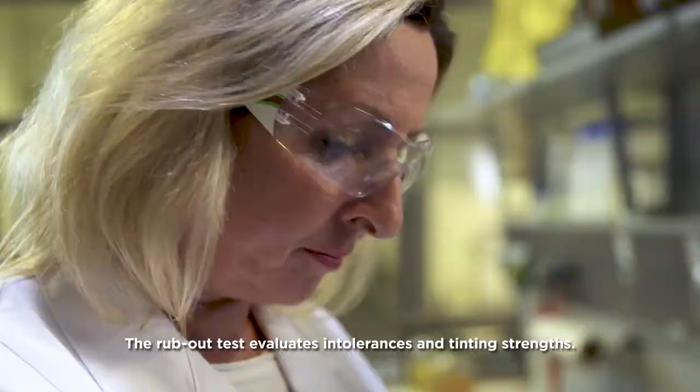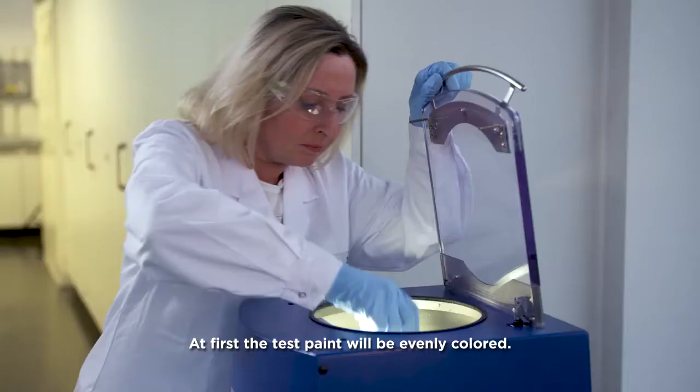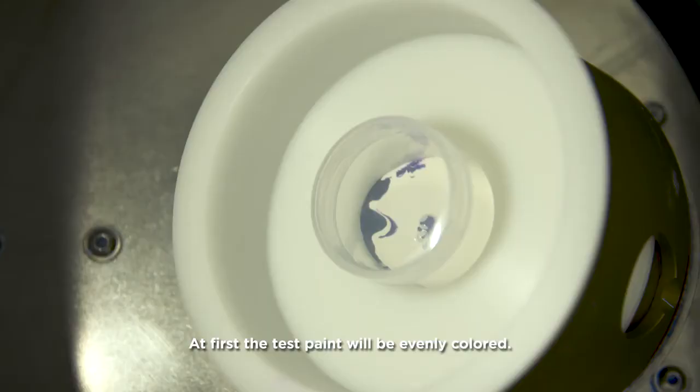The rub-out test evaluates intolerances and tinting strengths. At first the test paint will be evenly colored, best done in the speed mixer.